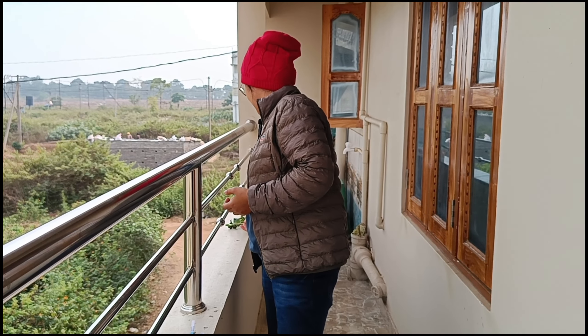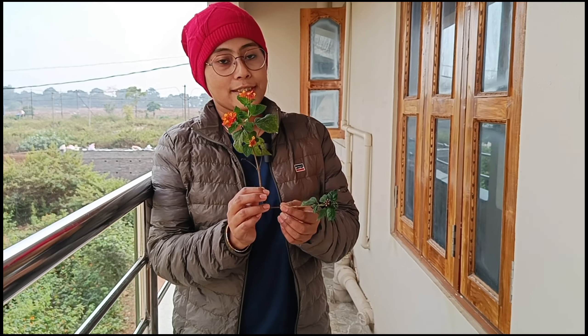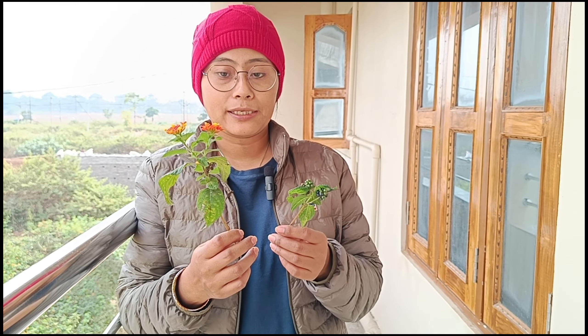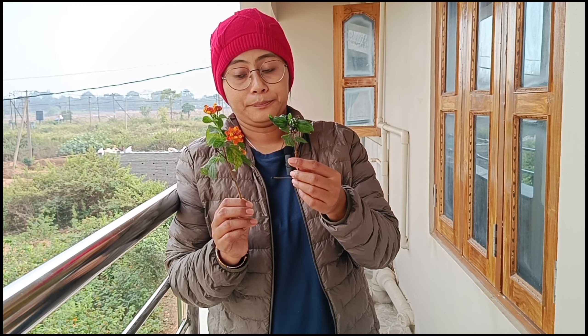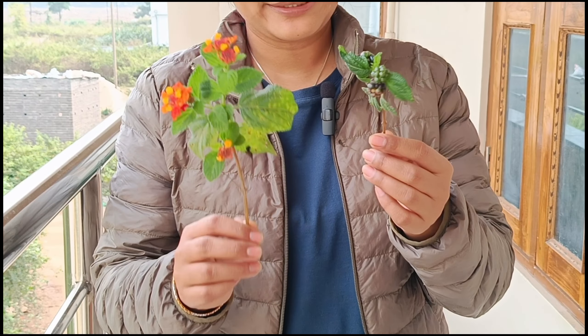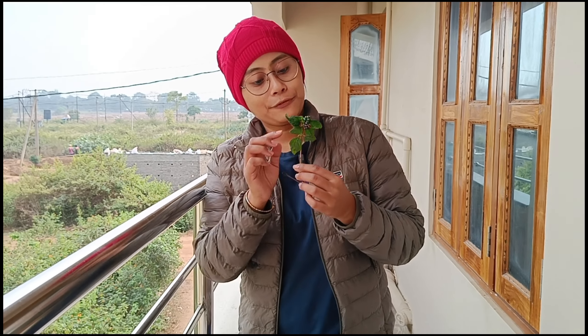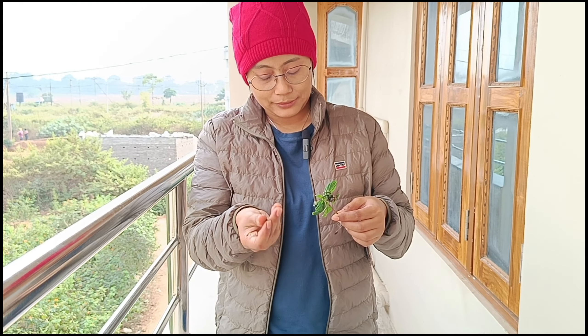You'll easily find this plant — it is Lantana camara, a kind of invasive plant you'll find in most places in India, especially mainland India. Let's look at the fruits — these fruits contain certain compounds that you just need to detect.